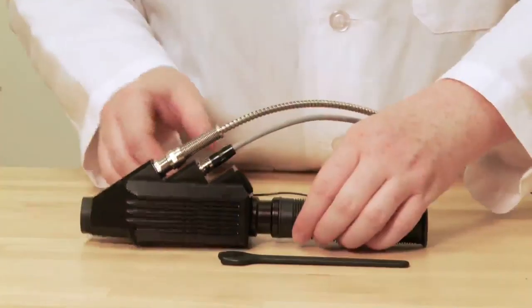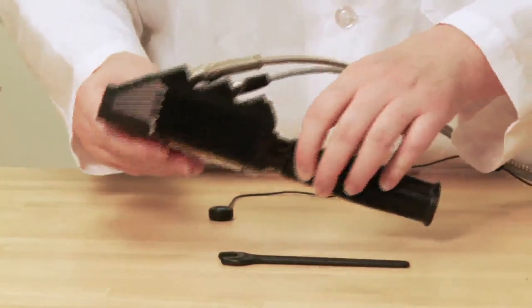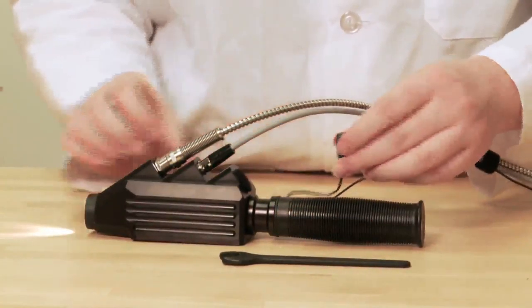Connect the accessory power cable and turn on the lamp. Connect the remote trigger using the hook and loop sticker.